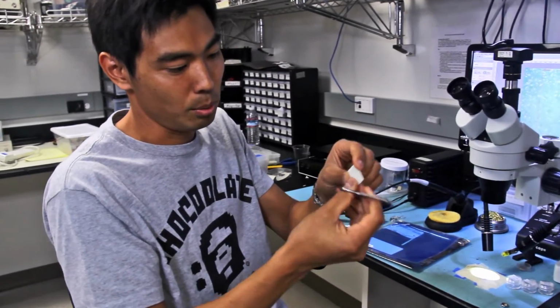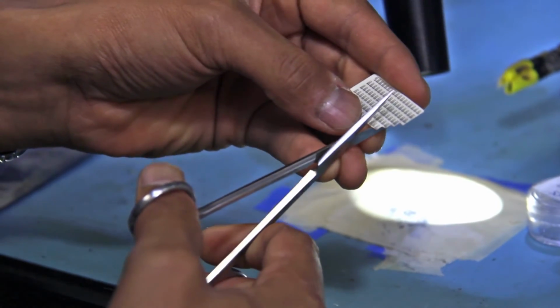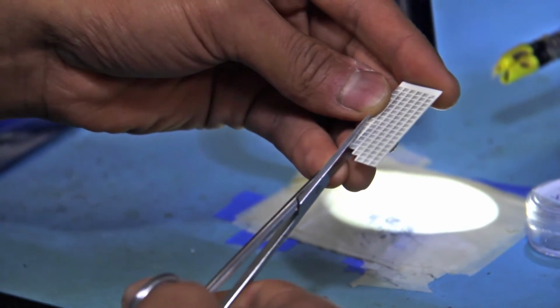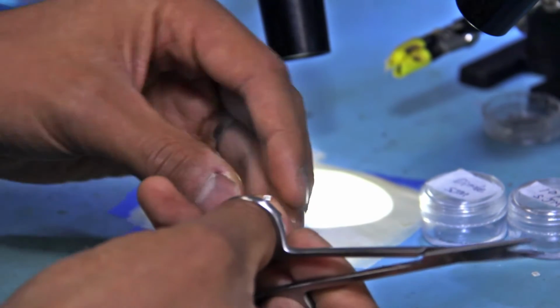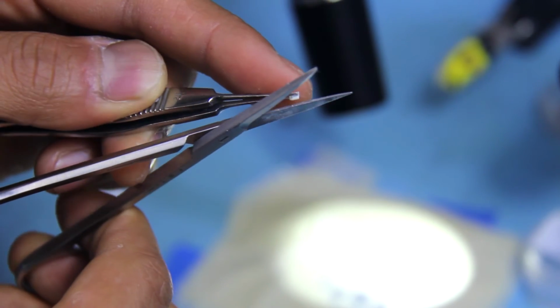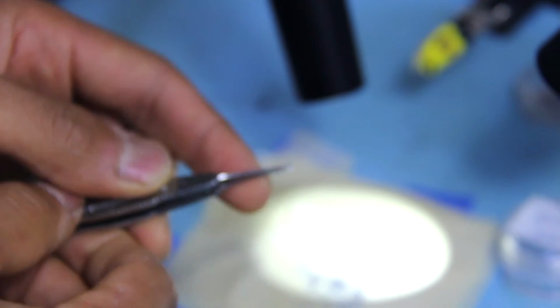First, let's cut the board. Just use the small scissors. It's pretty easy to cut the board because this material is Rogers 4350, and it's only 0.5 millimeter thickness. So after you cut, make sure it's small enough. Okay, let's cut this down even smaller by using scissors and tweezers. Okay, now let's take a look under the microscope.